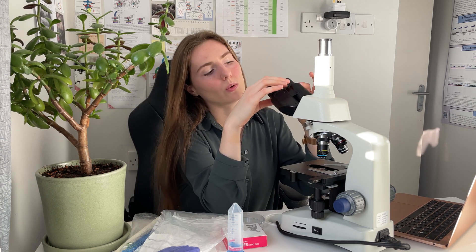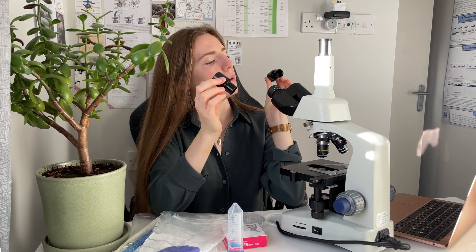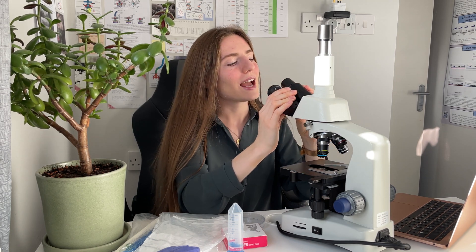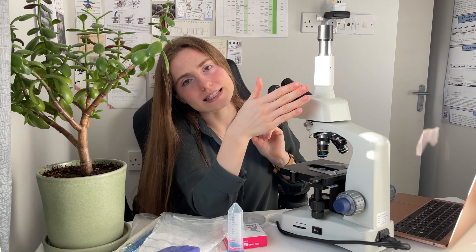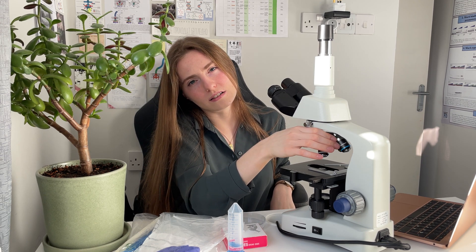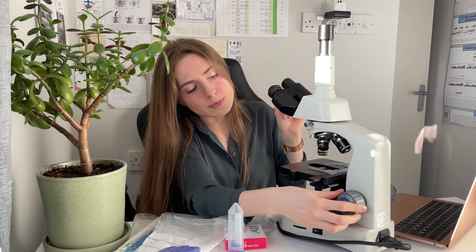First of all, let's remind ourselves how the microscope parts are called. Those are ocular lenses — one for me and one for you. This thing is a diopter adjustment. This is the head, this is the arm, and this thing is a revolver. Those four lenses give you magnification from 10x to 100x and are called objective lenses. This is a mechanical stage where we will put our sample. This is a coarse adjustment, this is a fine adjustment, and this little thing here is the stage control.